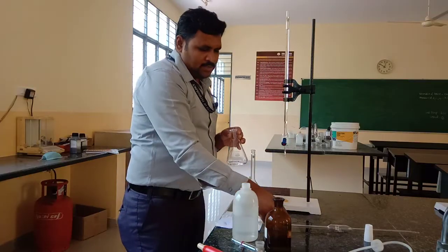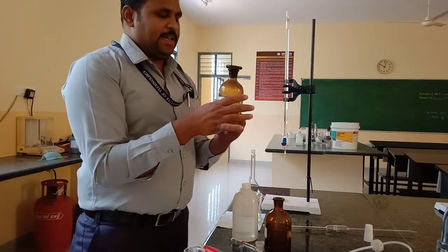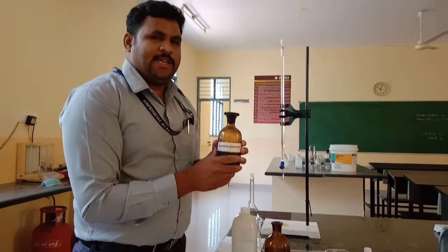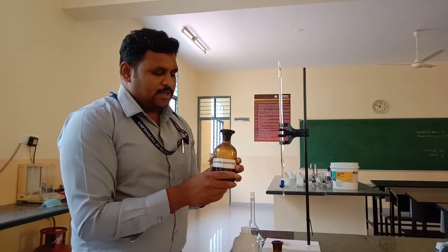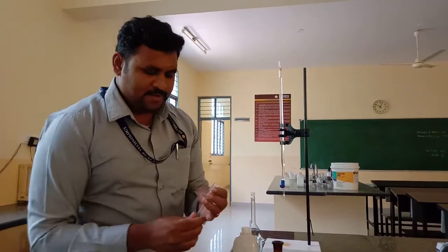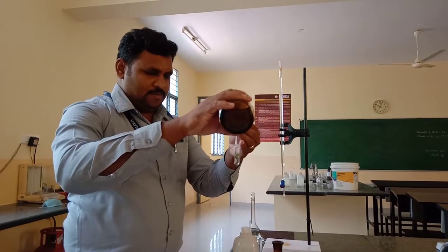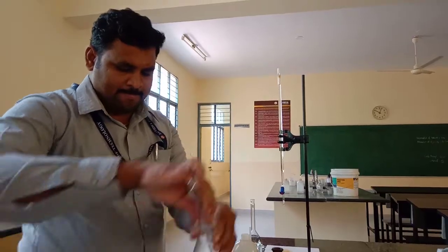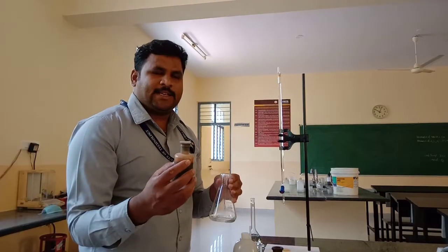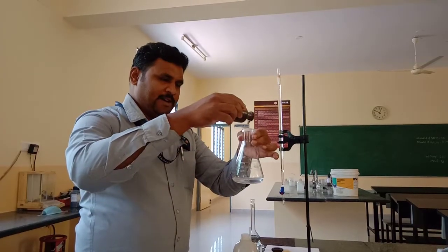Then add one more reagent — buffer solution — which maintains the pH value. This experiment requires a desired pH, so we are using an ammonia–ammonium chloride buffer solution. Add 5 cm³ of this buffer. After that, add the indicator — Eriochrome Black T indicator — 2 to 3 drops.